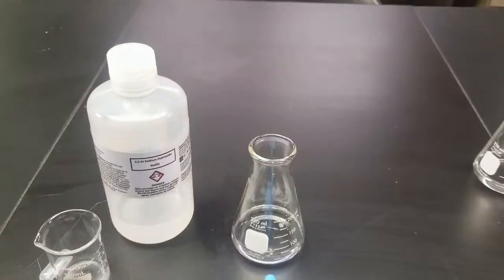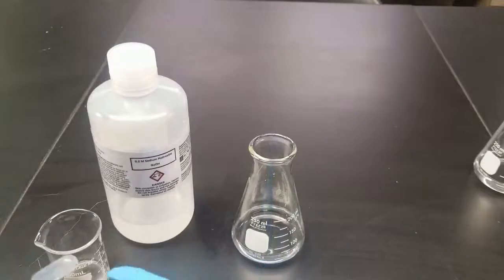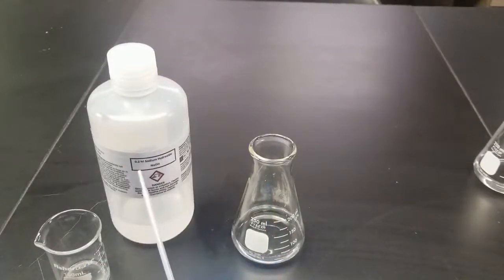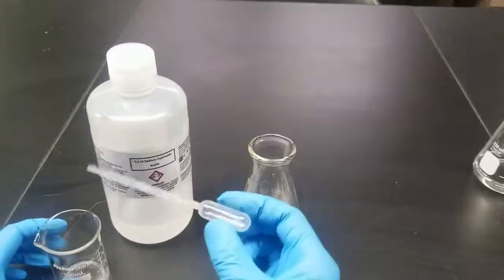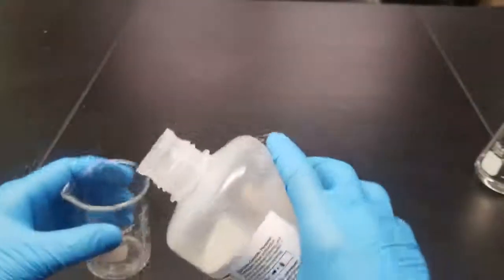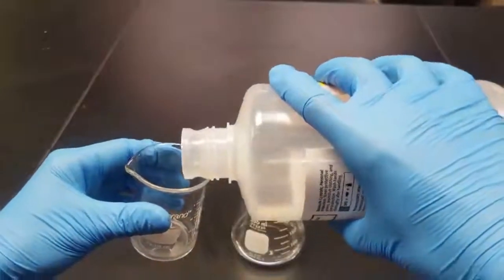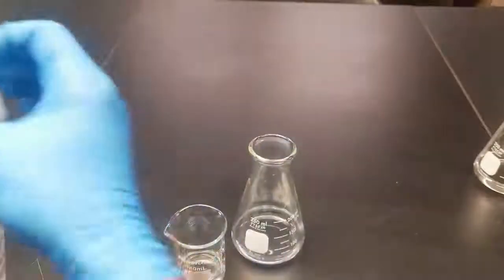And so what we want to do now is basically make the salt of this acid. And to do that, we're going to titrate it with 0.2 molar sodium hydroxide. Now in this experiment, we're not quantitatively determining how much sodium hydroxide we added, so there's actually no need to use a burette. So I'm going to cheat a little bit. I'm just going to pipette in my sodium hydroxide. So pour it into my secondary container because you never want to take from your primary container. That'll be more than enough.